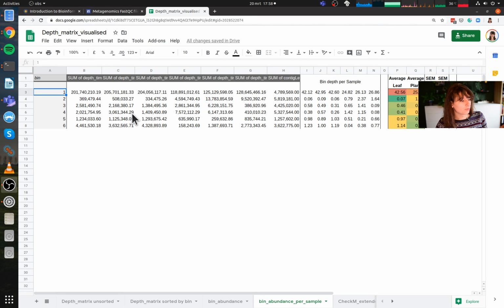So bin number four is the one over here. It's the one that's present not on the inside, but more enriched on the outside of the plant. So we've sampled two cyanobacteria. One is clearly on the inside and super abundant, and the other is not so abundant and clearly on the outside.